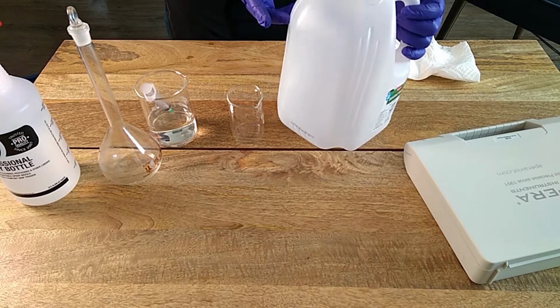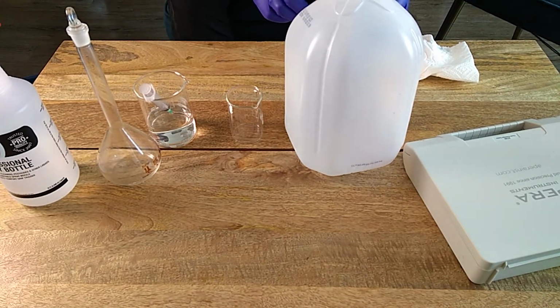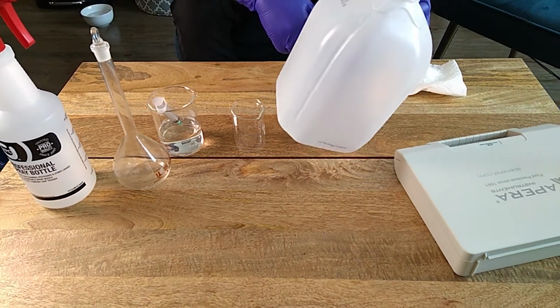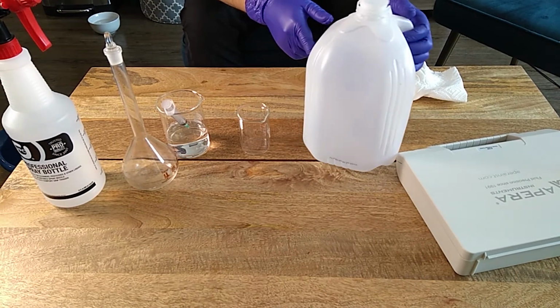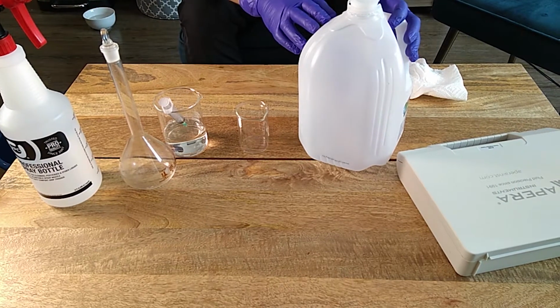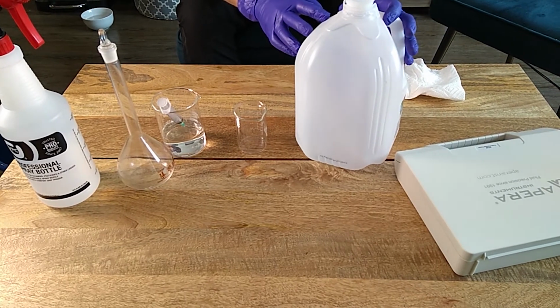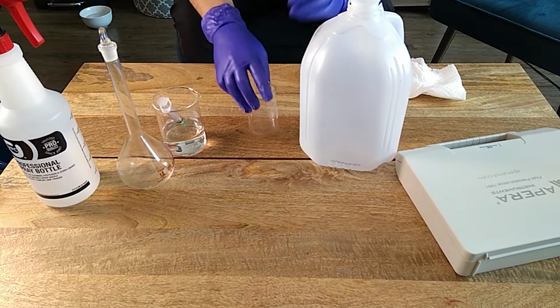Well, actually, this is very inaccurate. To where do you fill it up? These containers have no lines, and no way for you to tell whether you filled it up to 1 gallon or not. The same thing goes for tanks. Some of them have volume markings, but those are completely useless. The accuracy of those markings is extremely poor, not only because the tanks deform, but because they are simply not calibrated.